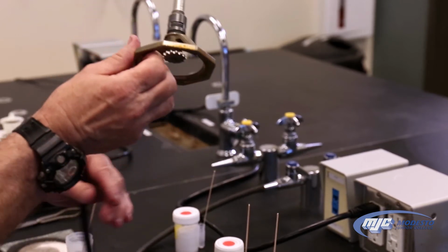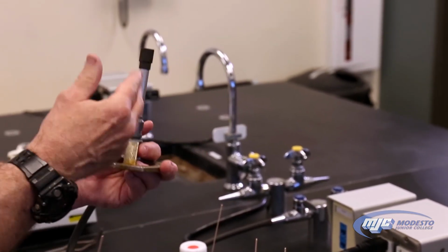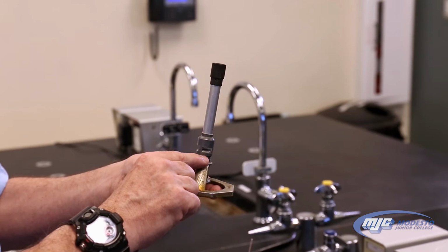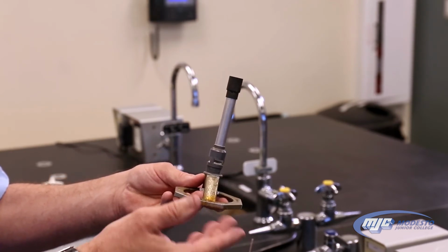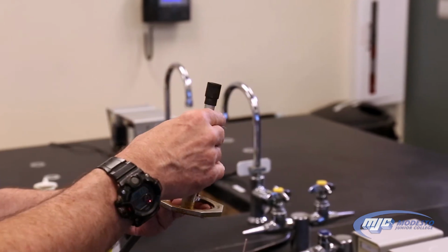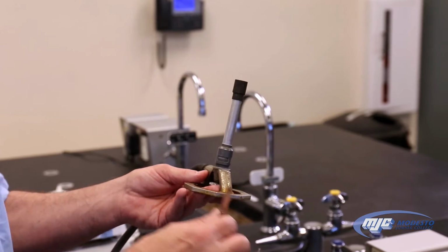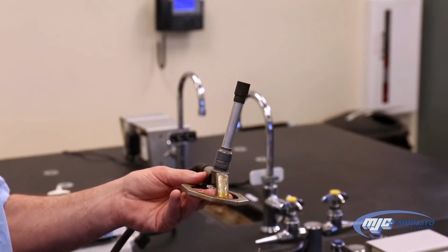That's our starting point. The third control on the Bunsen burner controls how much air, and that means how much oxygen gets to the flame. So that gap right there, that controls how much oxygen gets to the flame. The bigger it is, the more oxygen there is to the flame. Now, we don't want too much oxygen getting to the flame because it blows itself out. So what we're going to do is we're going to start with that gap about 1 millimeter or so between the top of the threads and the top of the gap, right about there. And we'll adjust it from there.